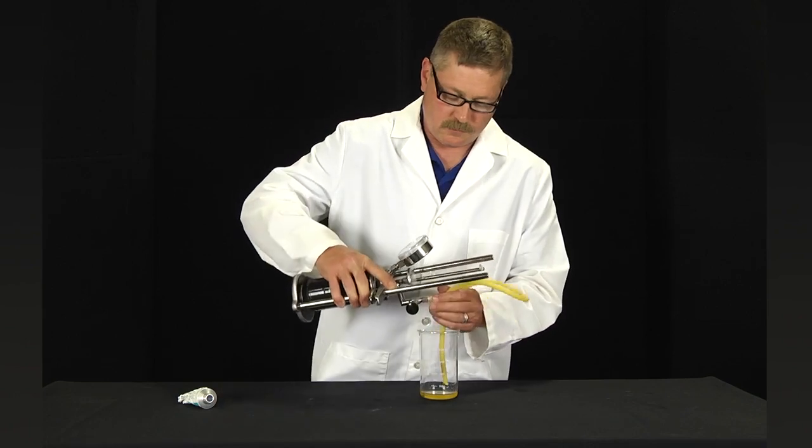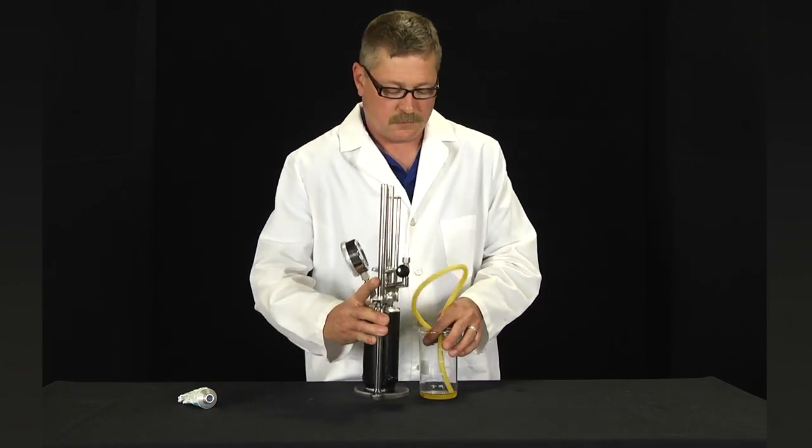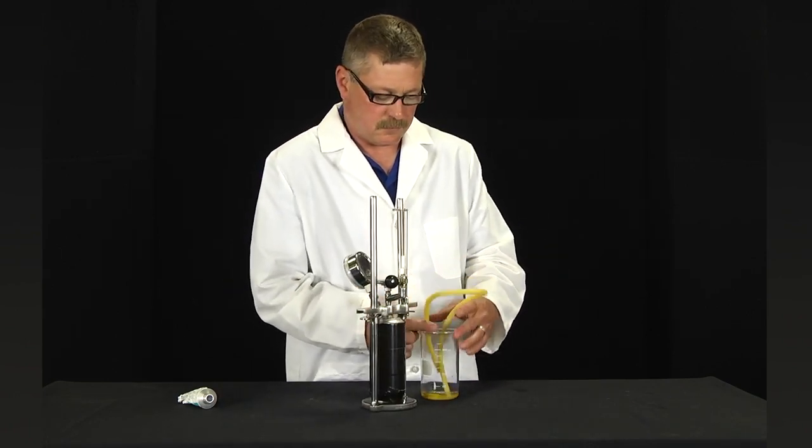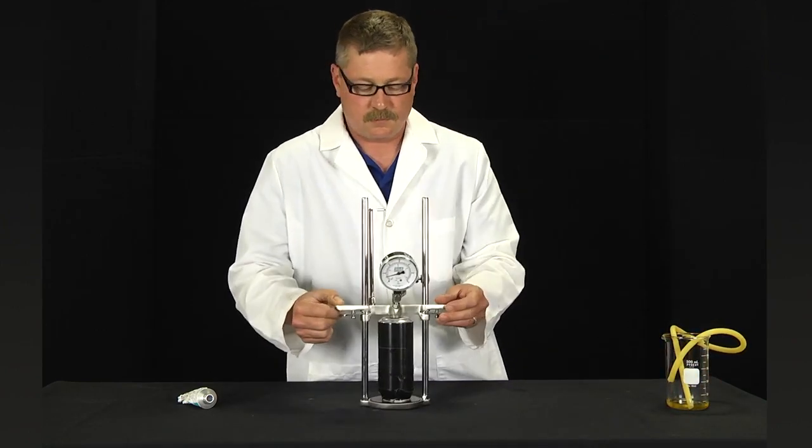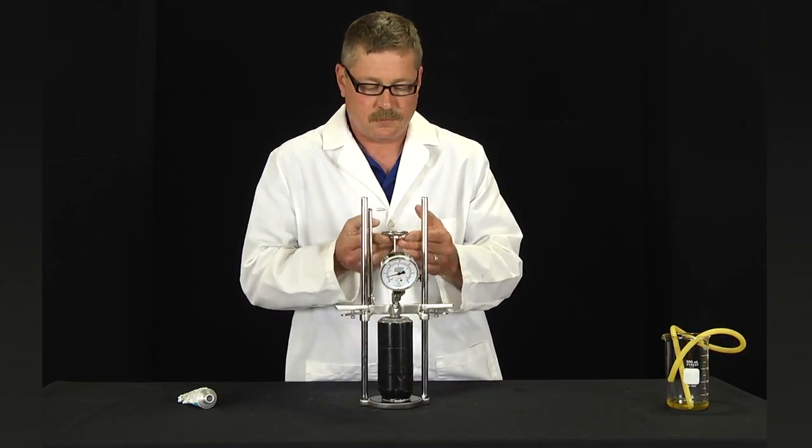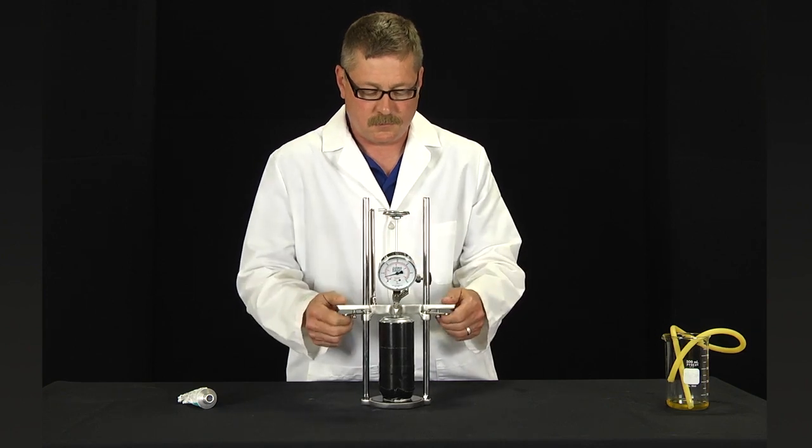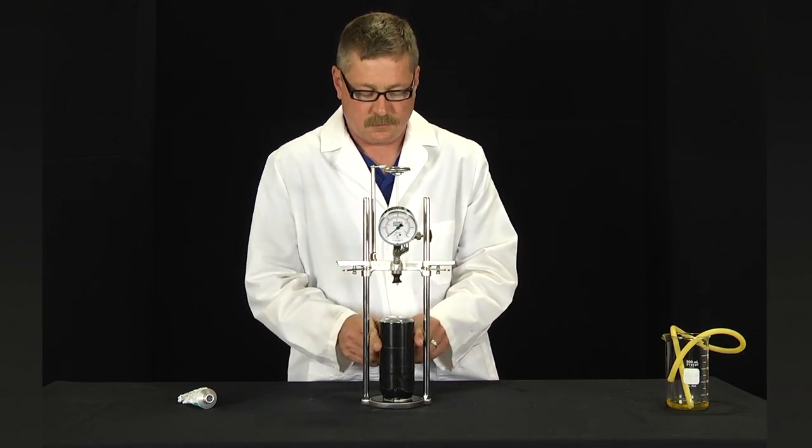Remove the plastic tubing. Withdraw the dial thermometer until it touches the dial thermometer stop. Raise the crossbar and remove the container.